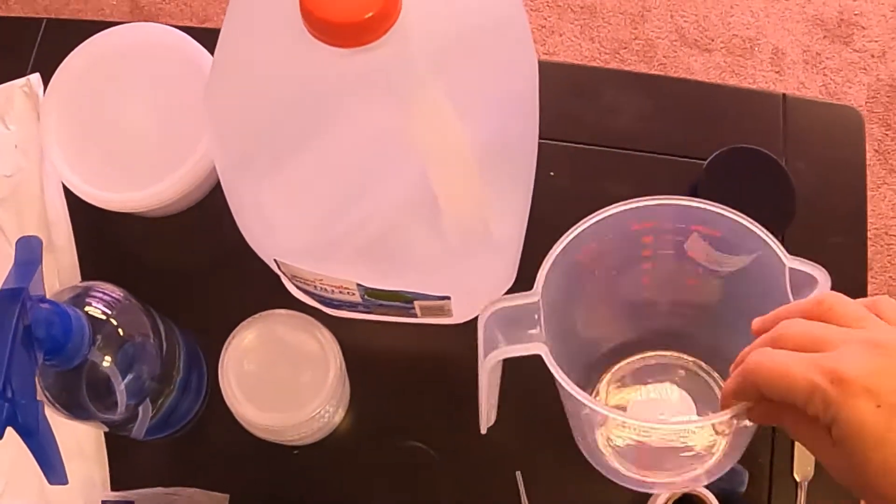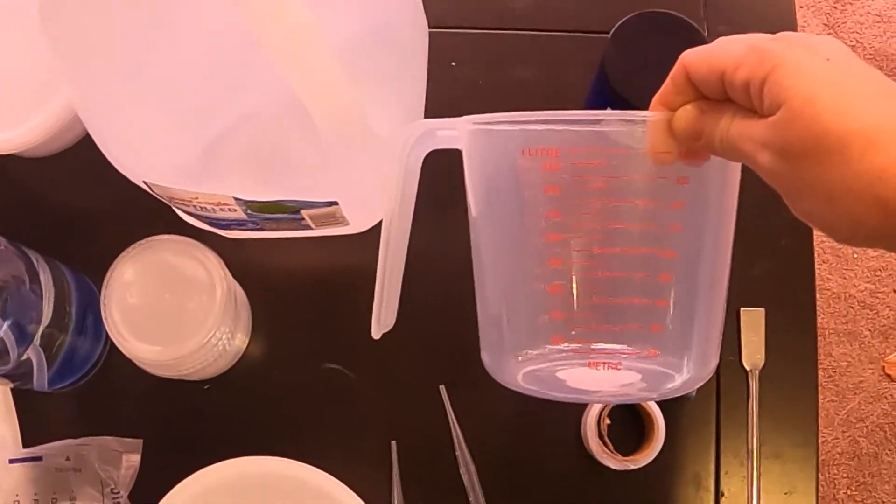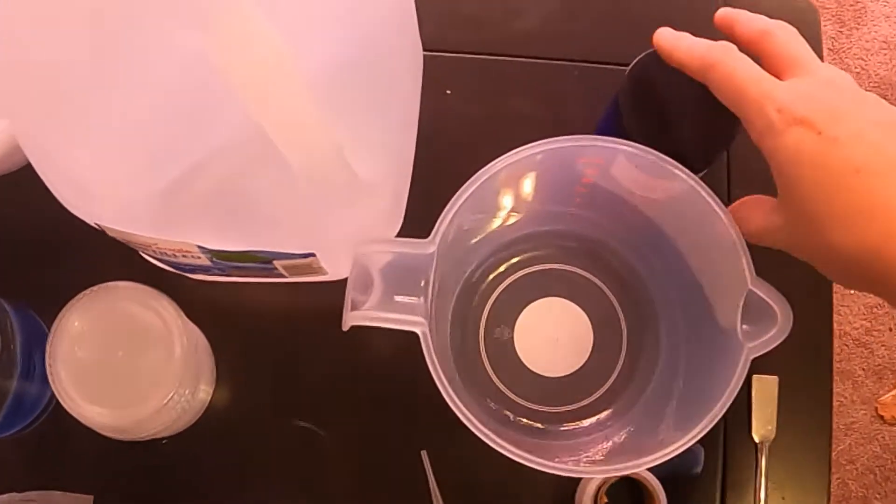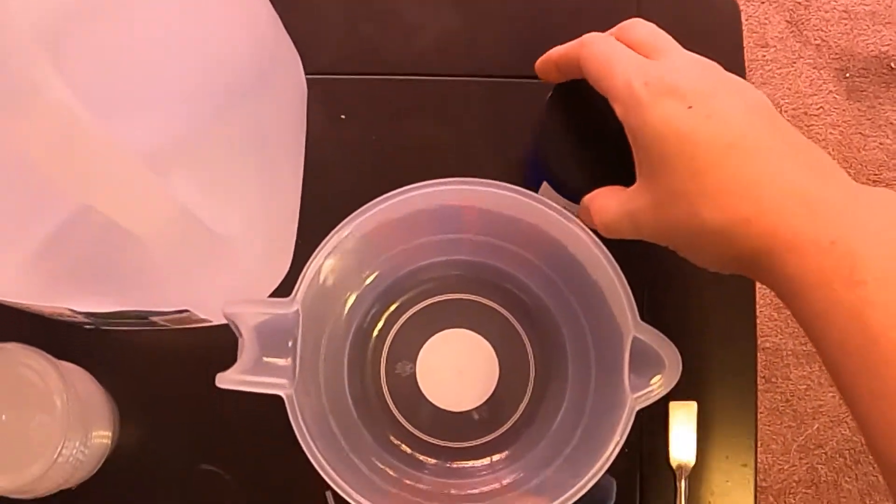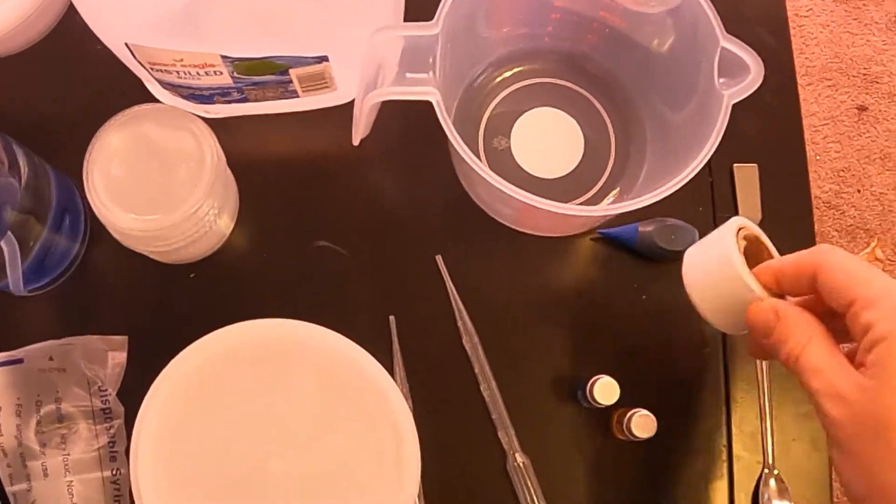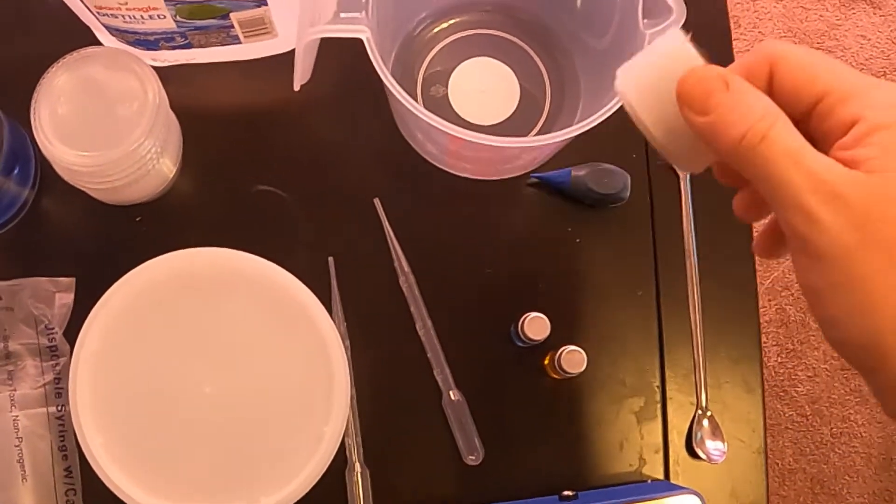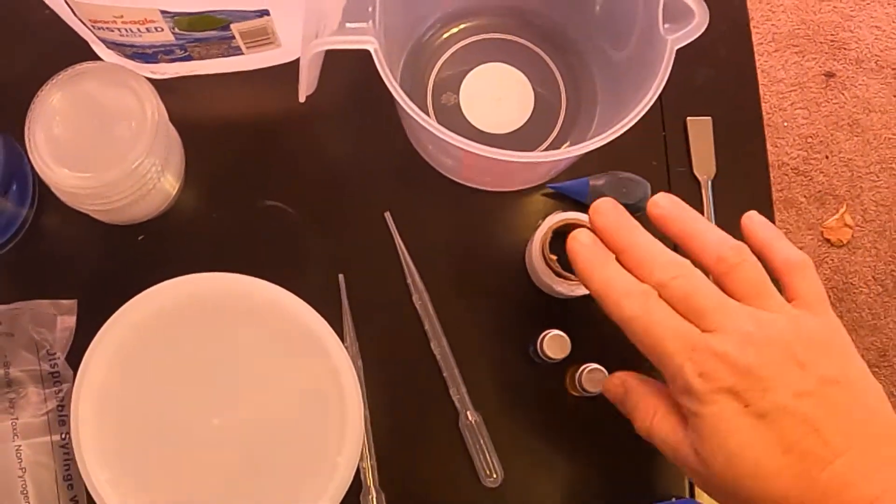I have a container that will hold one liter. I have my jar of philodendron multiplication media from Scalpel and Stem. I have some saran wrap to seal my containers once the media is in there.